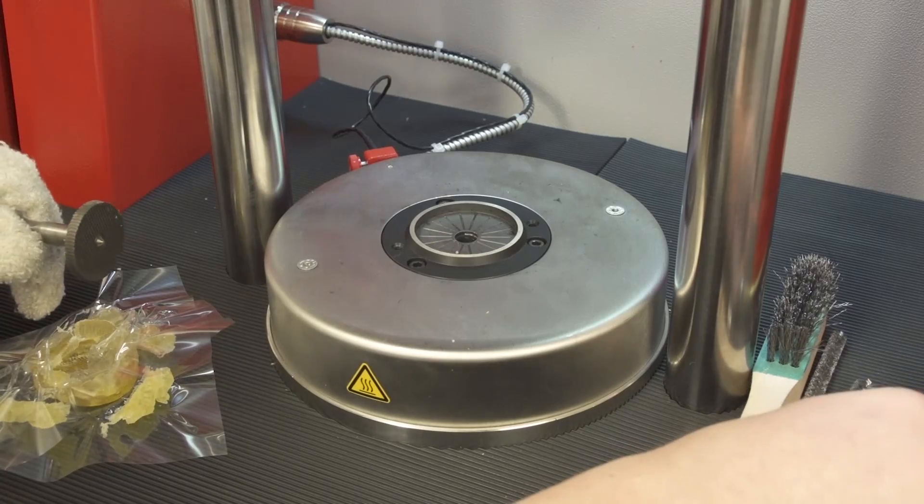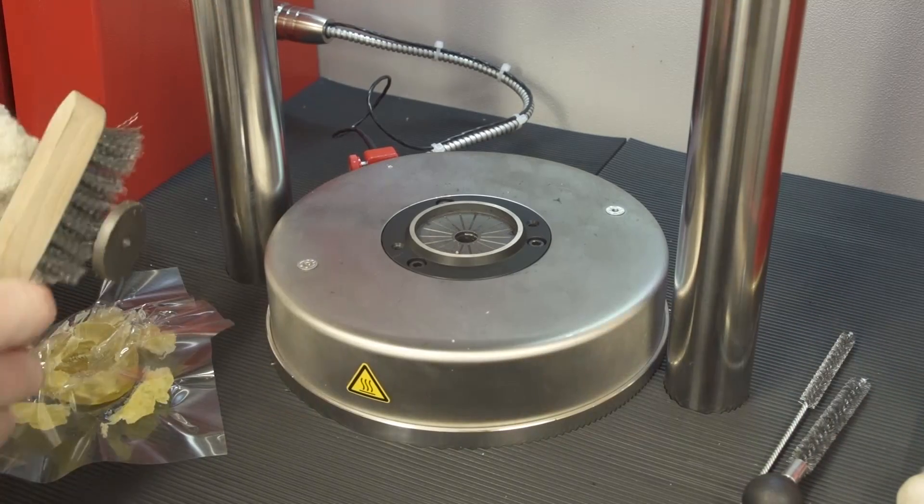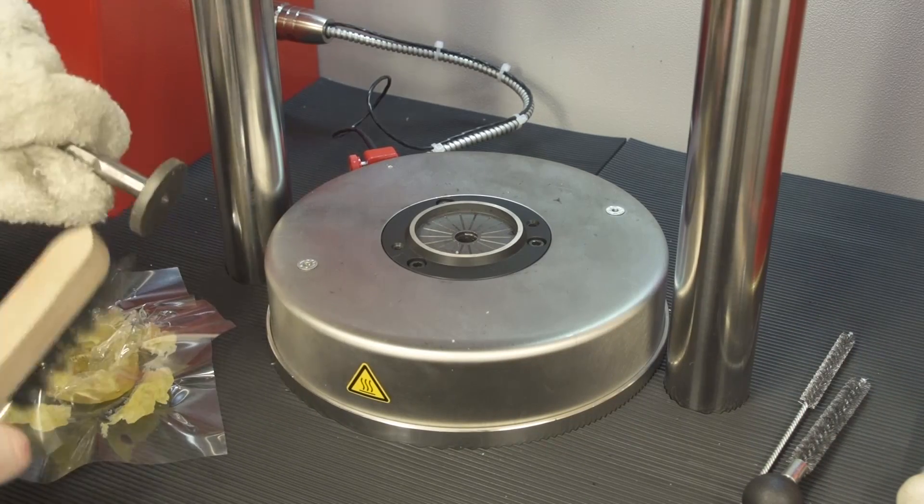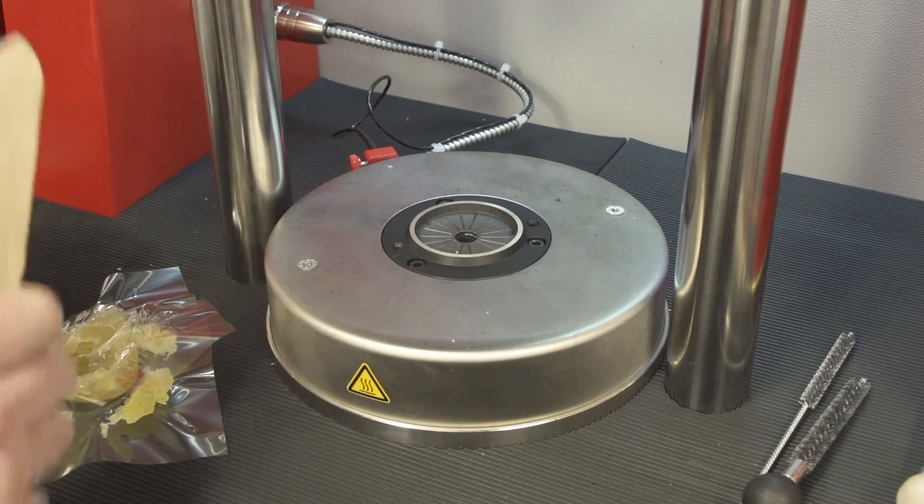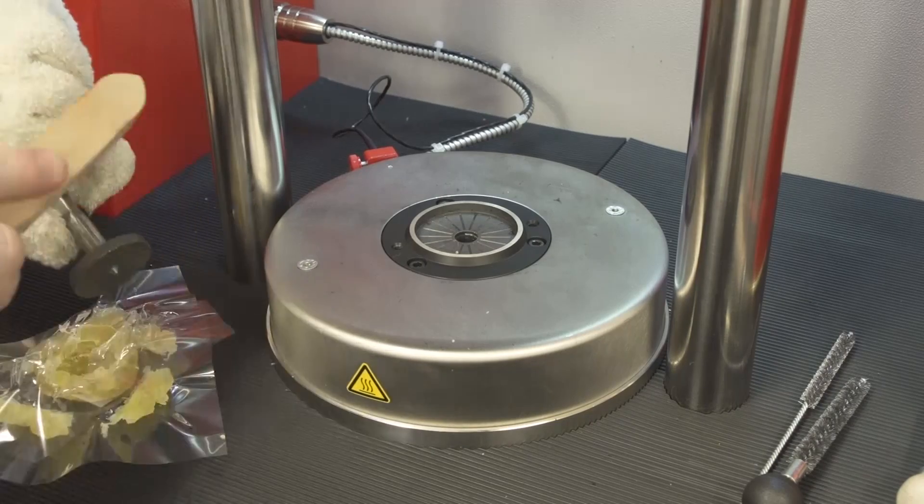Before either running the next test or putting the rotor back in the dies, carefully clean the rotor from any residue. Always make sure the rotor is in a perfect clean condition.